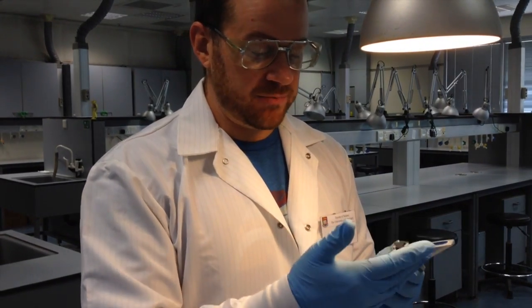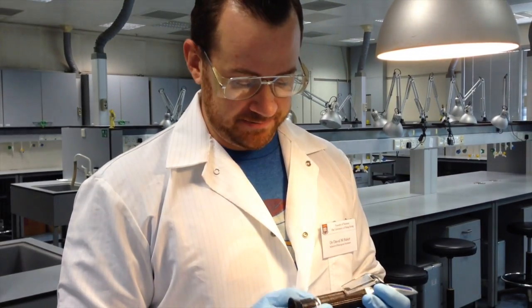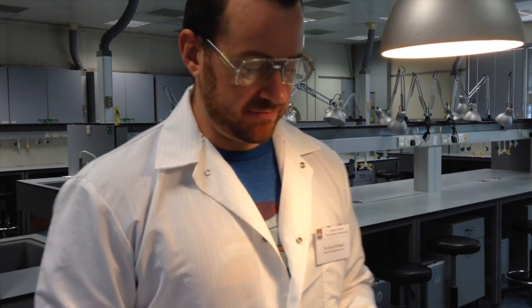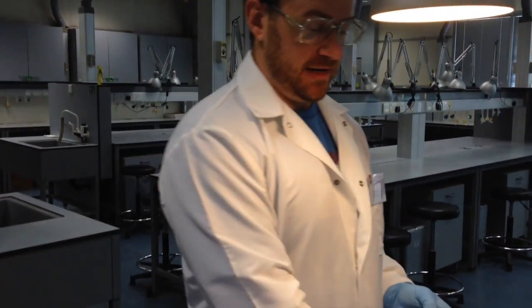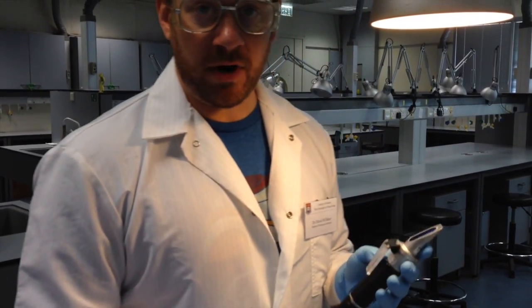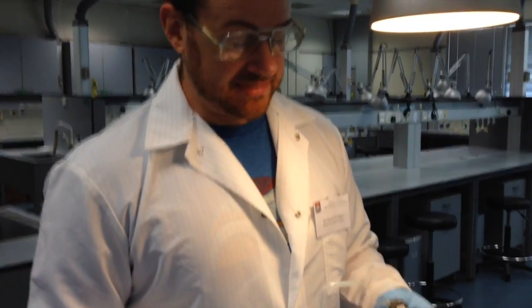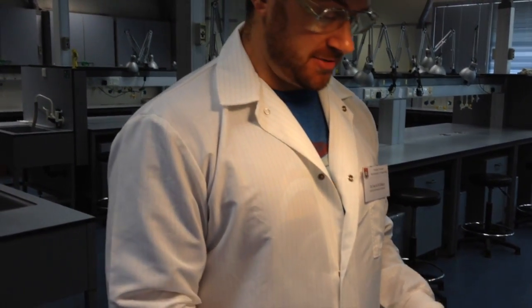And the degree at which that light is bent, or its refraction, is influenced by the salinity of the water that we're testing. So today we'll be measuring some seawater samples, so we expect the salinity to be much higher than fresh water. But just to show you how to use this, we open up the lid of the refractometer, and we can apply a little bit of water using an eyedropper or a wash bottle, or sometimes even just by dipping the refractometer into that solution. It's a pretty tough little instrument.